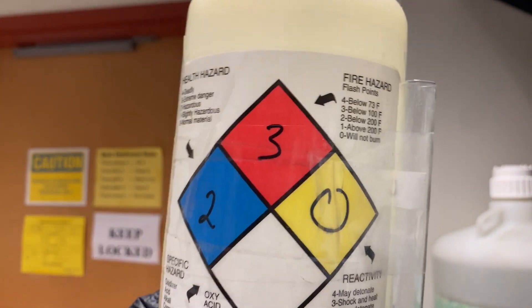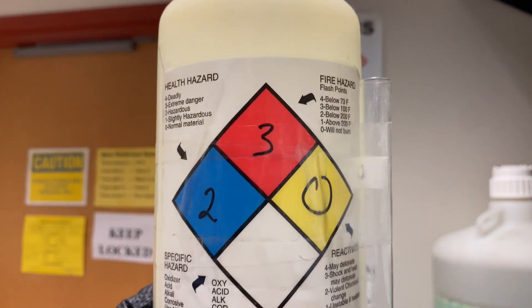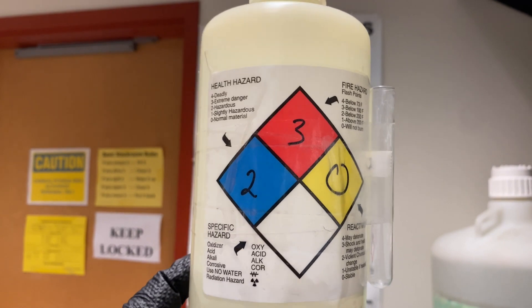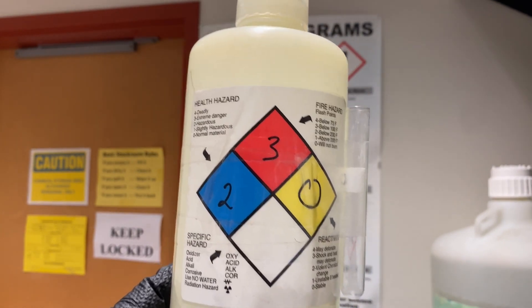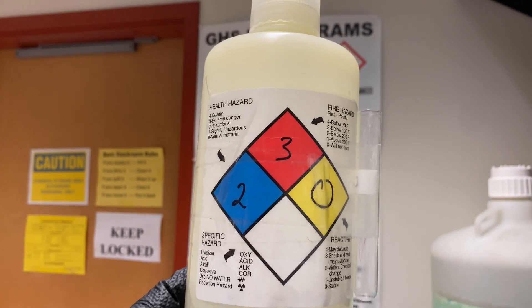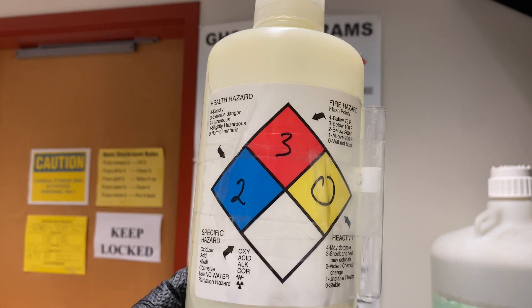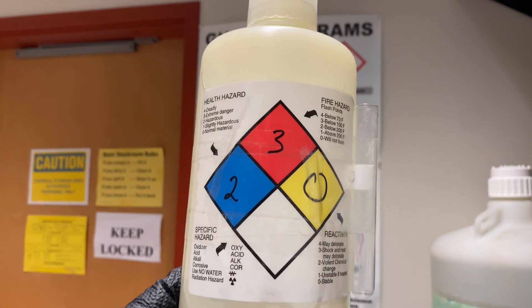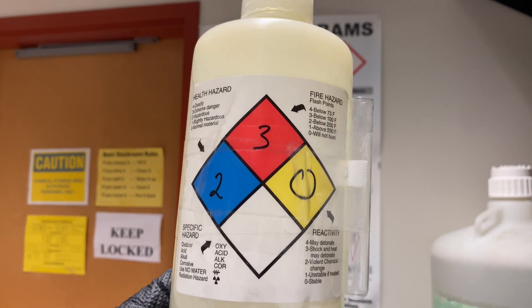Here is an example of a chemical that we have inside the stock room with the same label attached to the bottle. Each bottle inside of the stock room is going to have one of these labels in the back for our knowledge as well as the students' and TAs' knowledge.